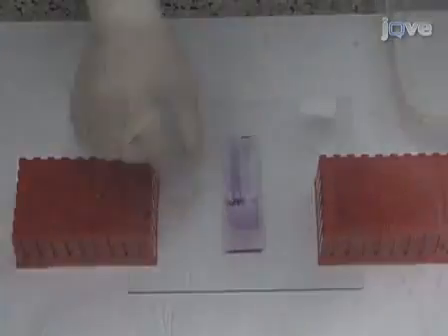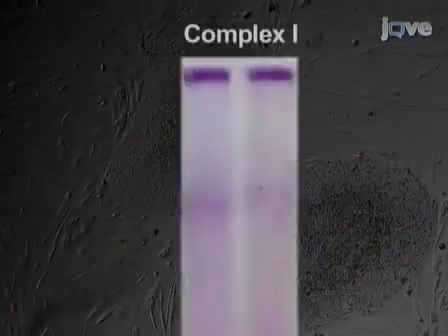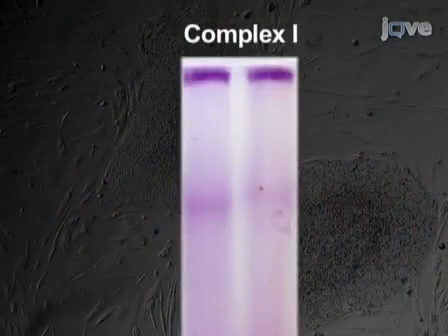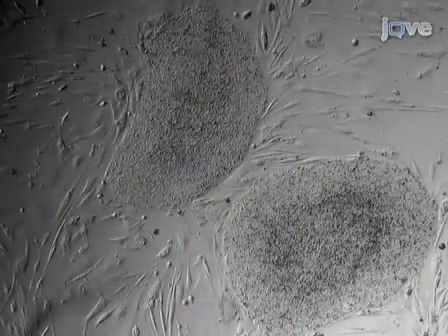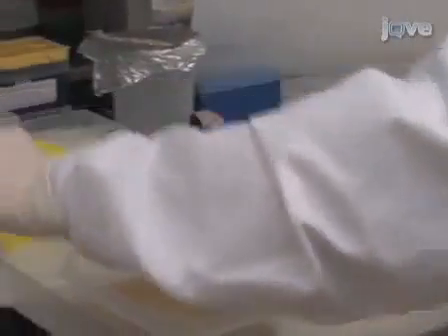Hi, I'm Ivan Kvorostov from the laboratory of Michael Teitel in the Department of Pathology and Laboratory Medicine at the University of California, Los Angeles. Today, we will show you a procedure for assessing mitochondrial respiratory complex function in human embryonic stem cells with in-gel activity assays.